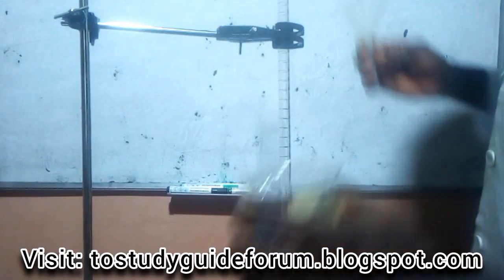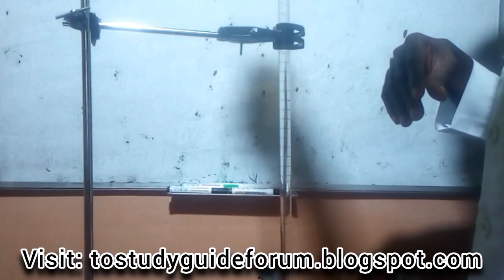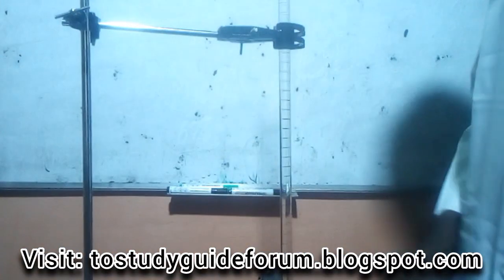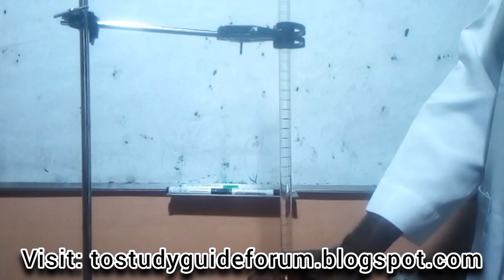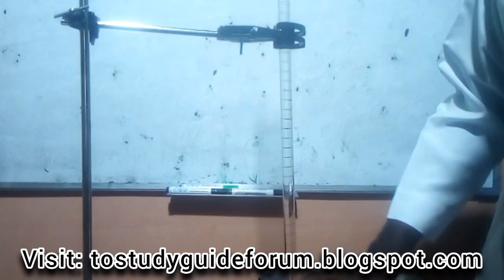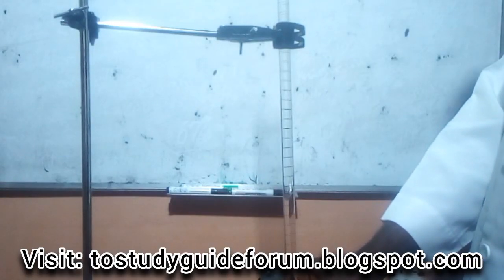So I have my B, and always remember to remove your funnel to avoid error. And here in the other side of it, the nozzle of this burette must be filled up to avoid air bubbles, trapping air bubbles. Another thing is that you make sure your reading is at the zero marking. Now we remove the air bubble from the burette. Then the next one is to make sure we have it at the zero.